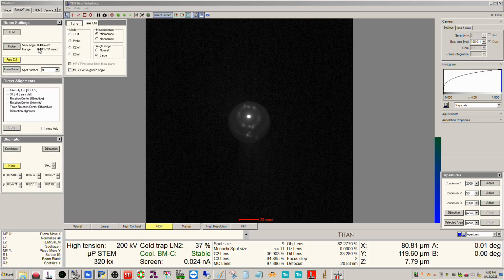A word about this number here for the semi-angle of convergence in microprobe mode. My experience is that when I actually measure this, it's actually about twice as big as this. Okay, so the way to actually measure this is if your Ceta camera is calibrated, make your camera length really large, and then project the direct disk onto it, and then just measure it. Okay, that's the easiest way to do it.